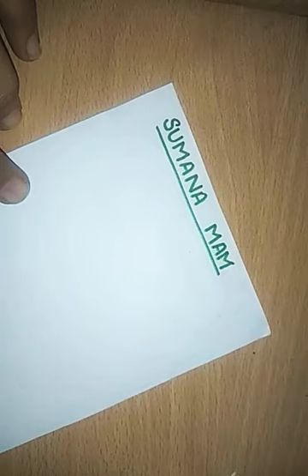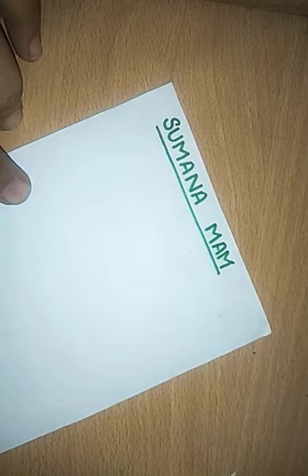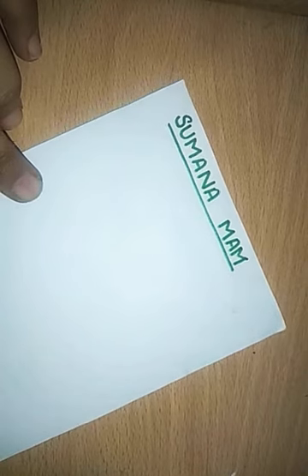Hello, my dear students. Today we are going to understand salt analysis, which is in your class 11th as well as class 12th, and this contains 8 marks. So we will understand the preliminary test and the confirmatory test and how to do each and everything with single minute details.